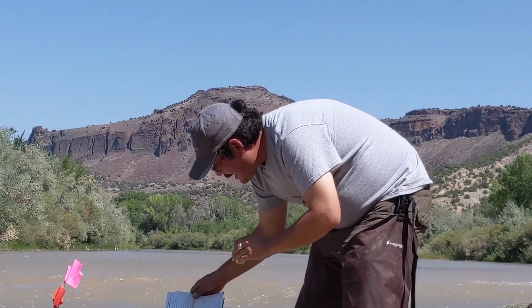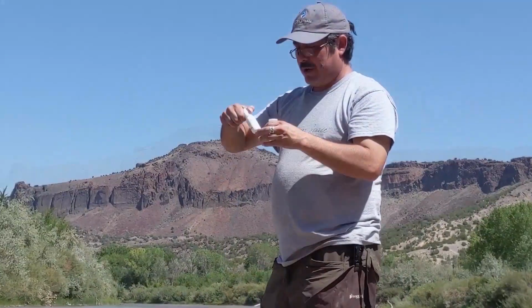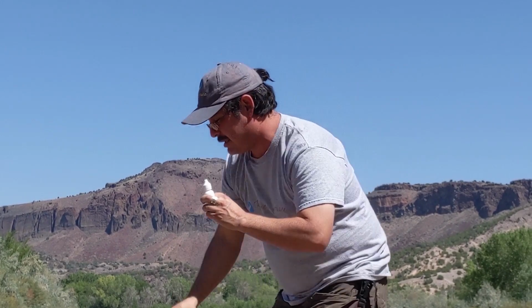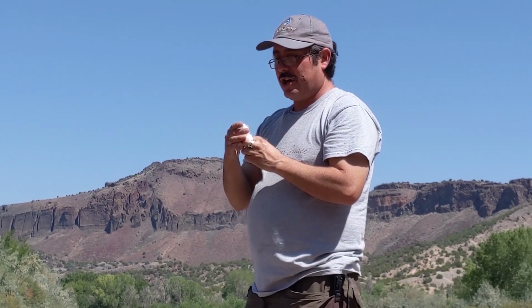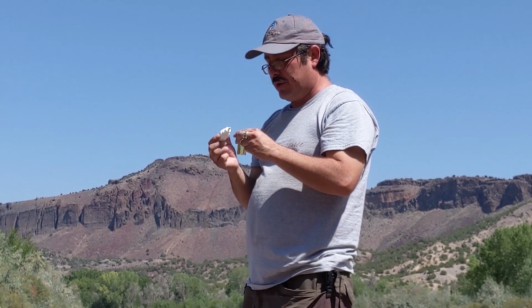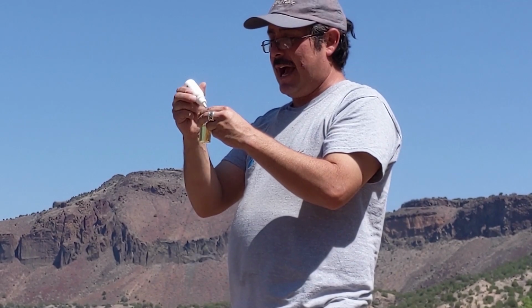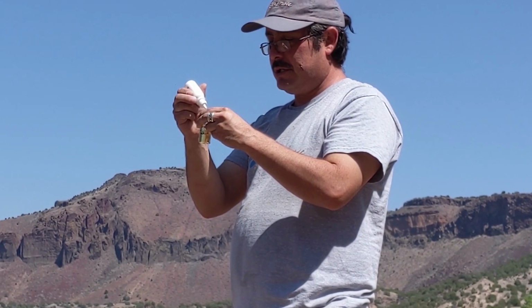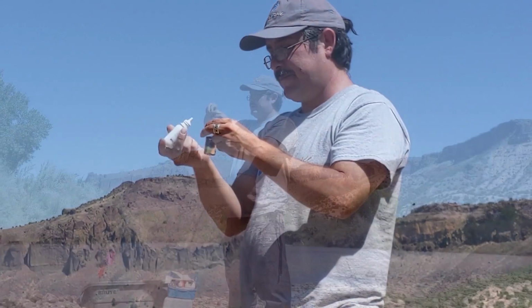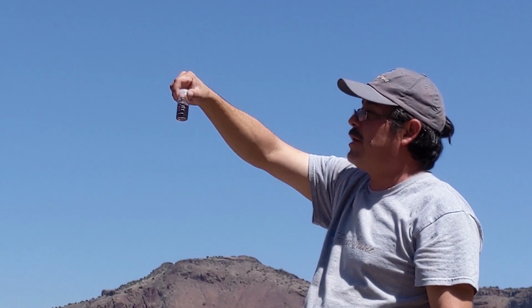Okay, so once it's pale yellow, it says to add 8 drops of starch indicator. Starch is one of the most commonly used indicators. When you place starch in the solution, it turns a particular color which is easy to see. And so again, I'm going to add 8 drops. 1, 2, 3, 4, 5, 6, 7, 8. And so as you can see, it's formed almost a purple or a black color.